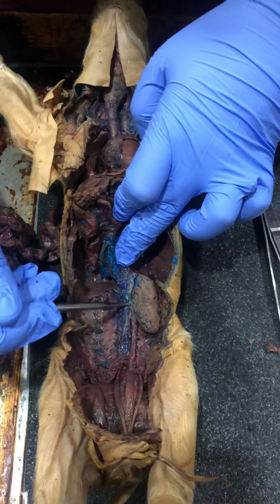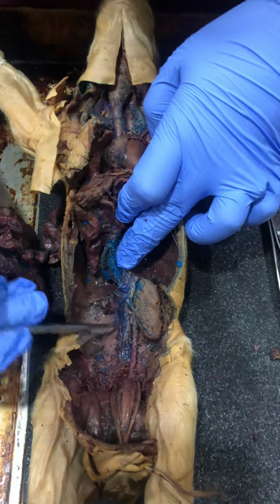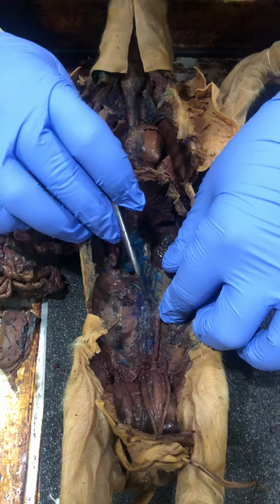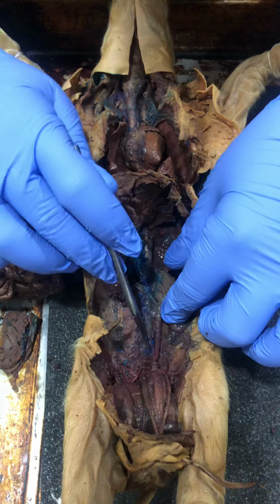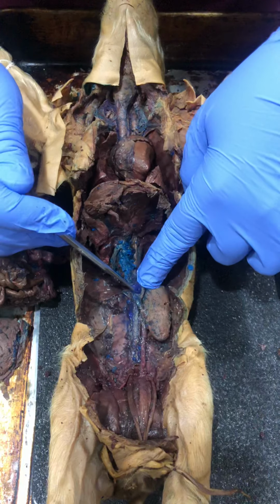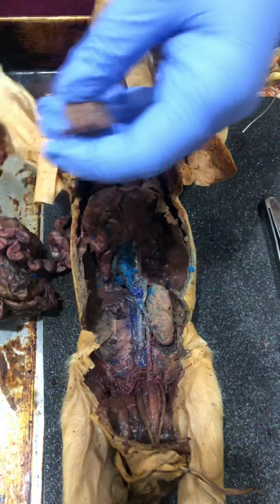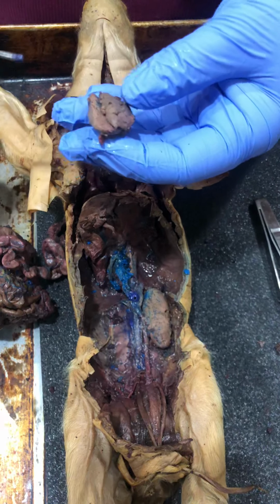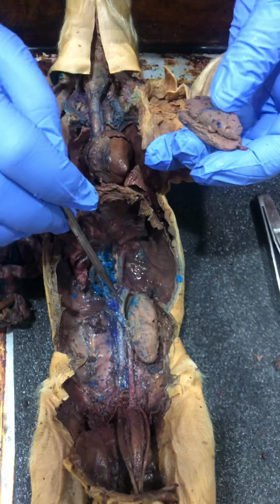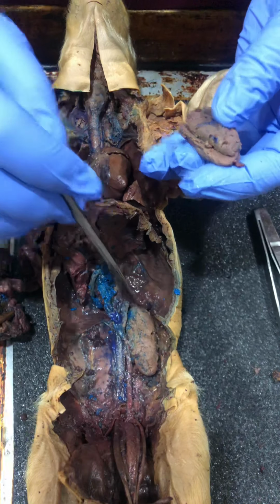And if you look really in, this up here is the renal vein, and then underneath the renal vein you can actually see the renal artery, and right here it connects into the aorta. Okay, so that's the function right there. You can even see it coming out right here, the dye. So I'm gonna go ahead and go into the outside, but another portion I want to show you right here is the fat around the kidneys. It shows right here. You can see it cushions on the top part.